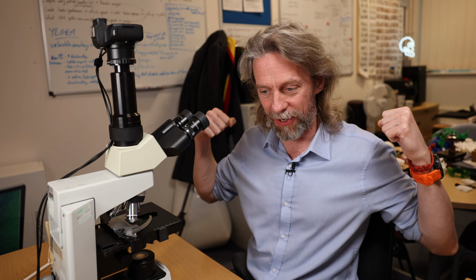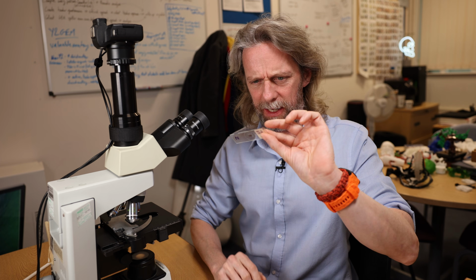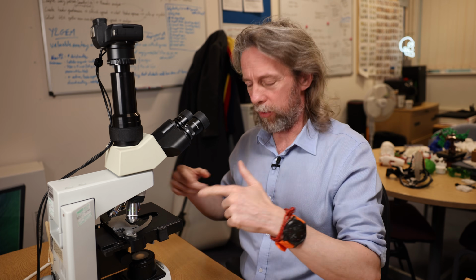Okay, today we're going to be looking at a mythical beast, the lymph node. I say mythical because when we're looking in the body, I struggle to dissect them and find them, to demonstrate them to students, but honestly they do exist. Here I've got a section of a lymph node on a slide that's been stained. I haven't looked at it yet. I guess it's probably hematoxylin and eosin like most of them, but we're going to have a look at the lymph node under the microscope.